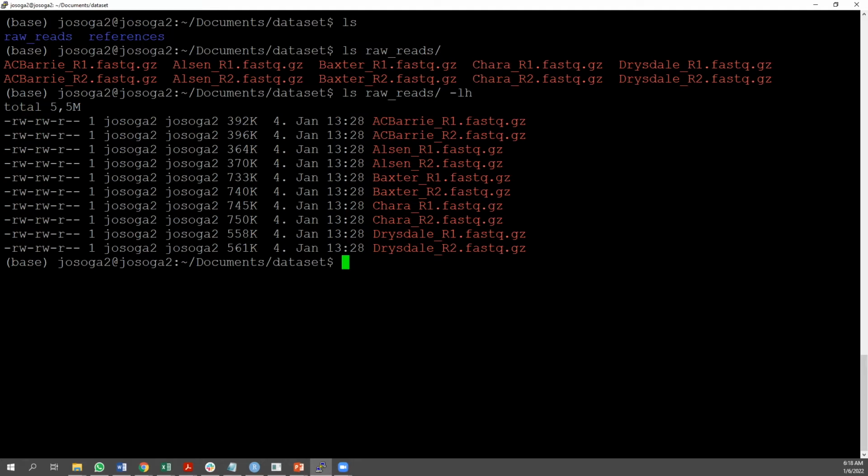within a YouTube video. The next thing to do is to create an output folder where your quality control report for each file will be saved. And to do that, you can just say mkdir QC reports. Sorry, my reports.